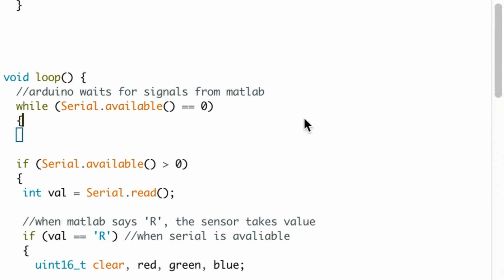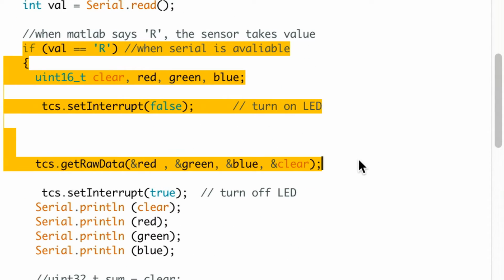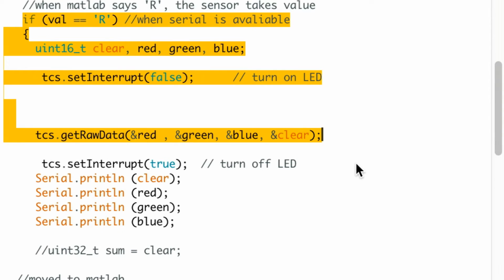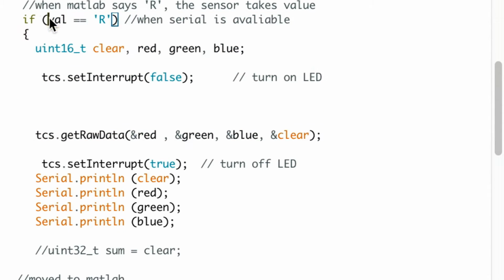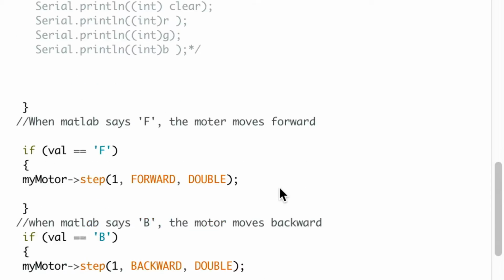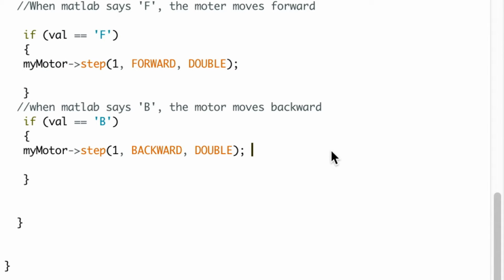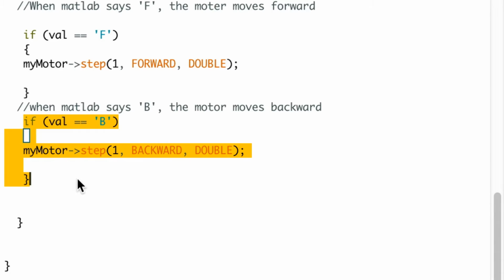There are three key components in the main function loop. The first one is called R. This is used to tell the color sensor to detect a color when MATLAB says the value R. The next key component is called F. When the MATLAB value equals F, we tell the motor to move forward. The last key component is called B. When the MATLAB value equals B, we tell the motor to move backwards.